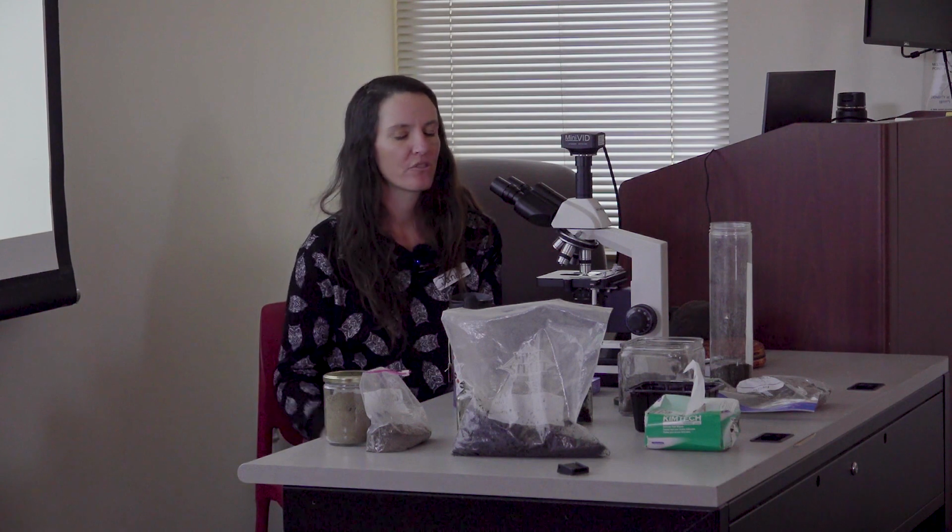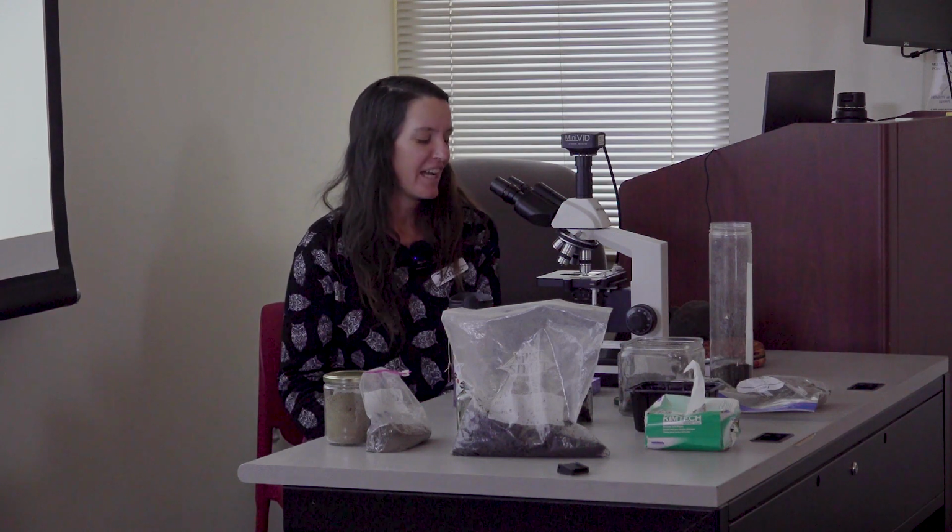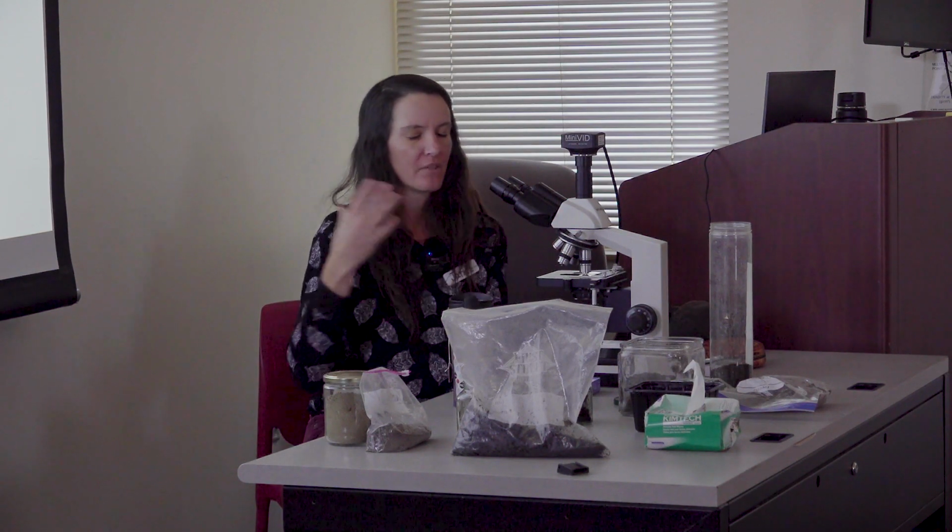I also supply a fungal to bacterial ratio, which can help you determine what the best applications for that compost would be, whether you have an agroforestry system or intensive annual vegetable production, things like that. We scan for pathogenic organisms. I talked a little bit about pathogenic bacteria, but there are also fungi, things like mildews, that we can identify morphologically under the microscope, and we have to have below a certain threshold of numbers of those organisms for you to be able to pass. And these counts are also contributing to the determination of diversity in your compost.